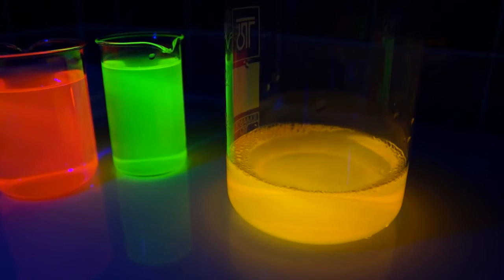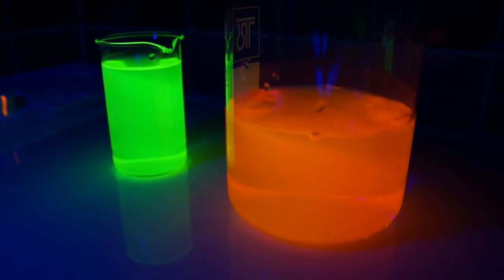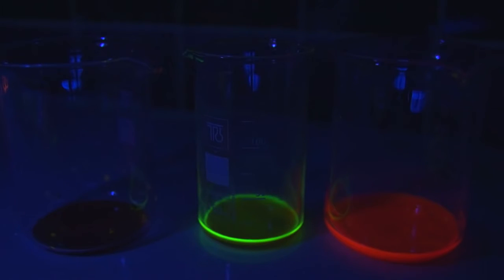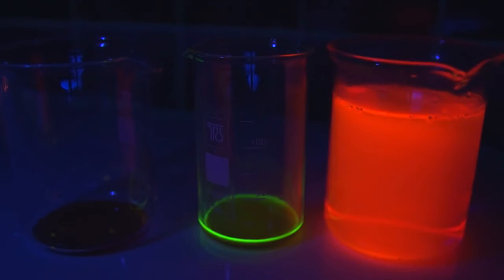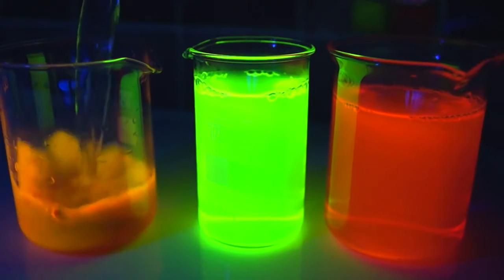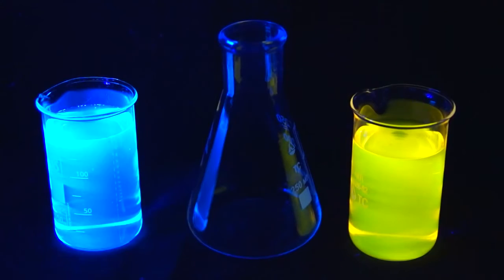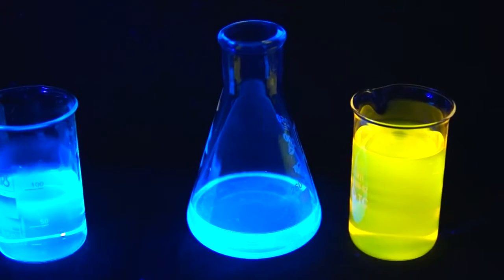First, I pour Rhodamine 6G, which is yellow. Next, I pour Rhodamine B — the solution turns orange. In the end, I'm topping it up with a solution of fluorescein. As we have mentioned earlier, saturated solutions of fluorophores do not glow under the UV light, but immediately upon diluting the concentrate with water, the solution begins to glow quite brightly. You can also get a white glow if you mix Schweppes and Rhodamine 6G — blue and yellow respectively.